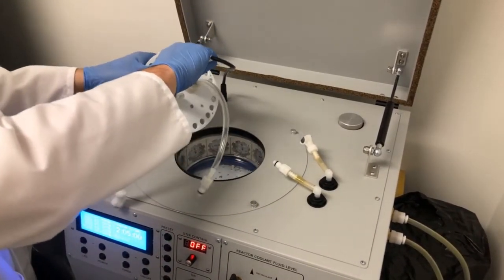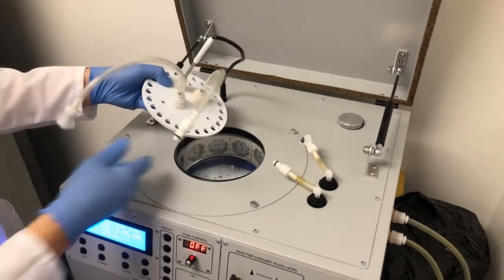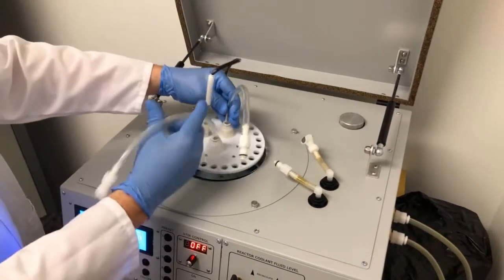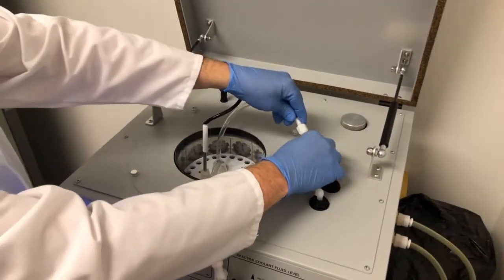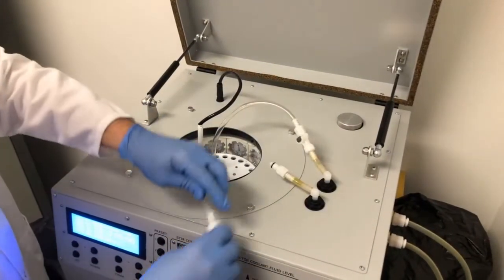Once we connect the temperature probe and everything is situated, the reaction vessel gets inserted into the reaction chamber. Then we use the quick connects to connect the inlet and outlet of the thermostatic fluid.